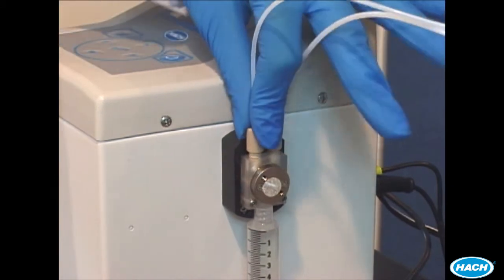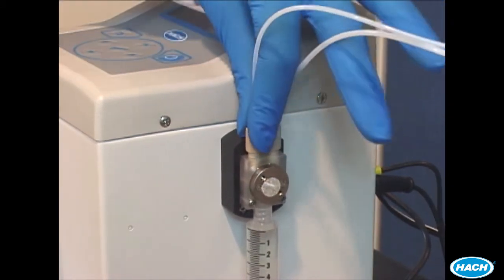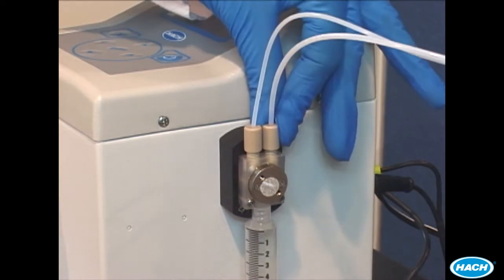Make sure all the fittings are secure as this can result in leakage of air or titrant and cause errors in your measurement.